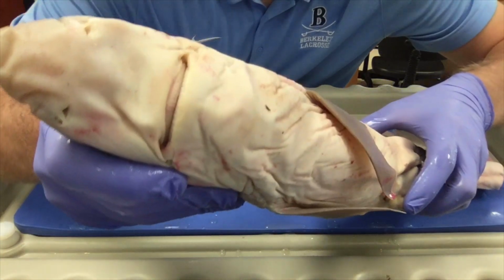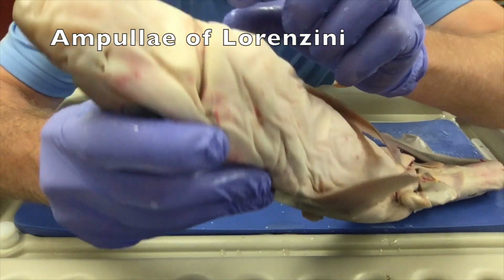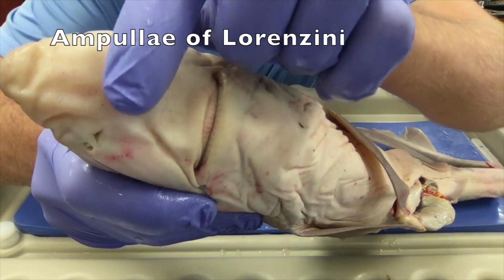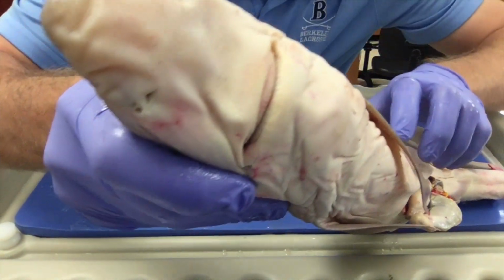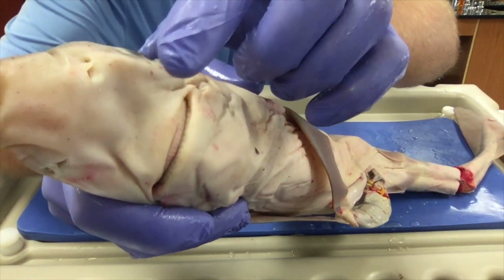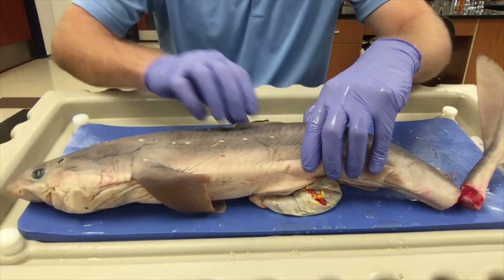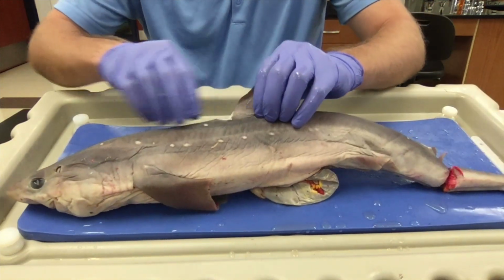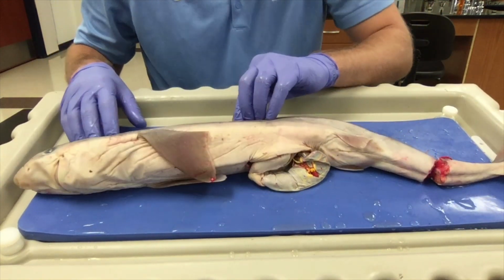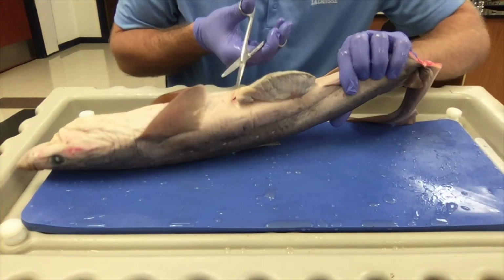Sharks also have sensory organs that are special called ampullae of Lorenzini. If you look very closely on the snout area, you should see lots of teeny tiny little holes. These holes actually house organs that are sensitive to electrical fields. They can pick up the electricity that their prey gives off when it moves to help them find food. All right, I'm going to go ahead and open up our shark and we'll take a look at its insides.